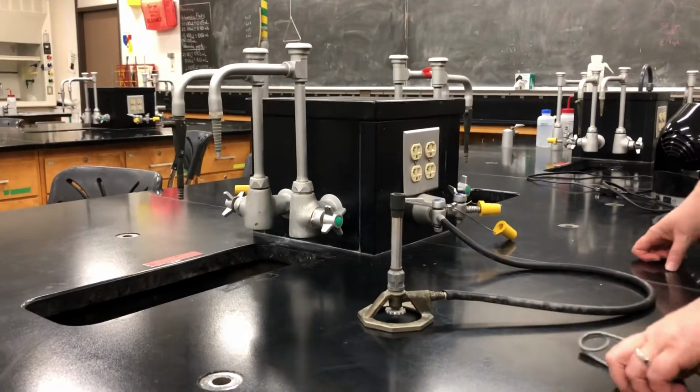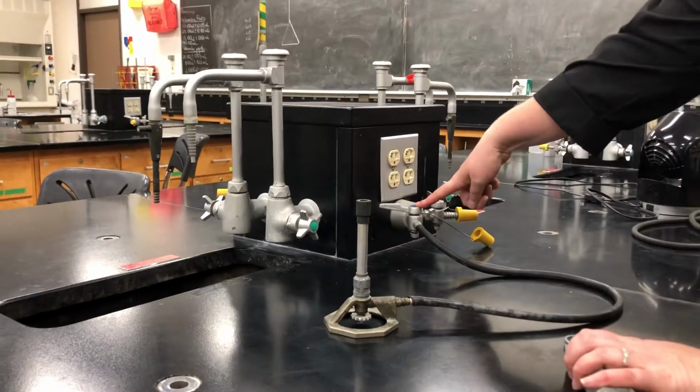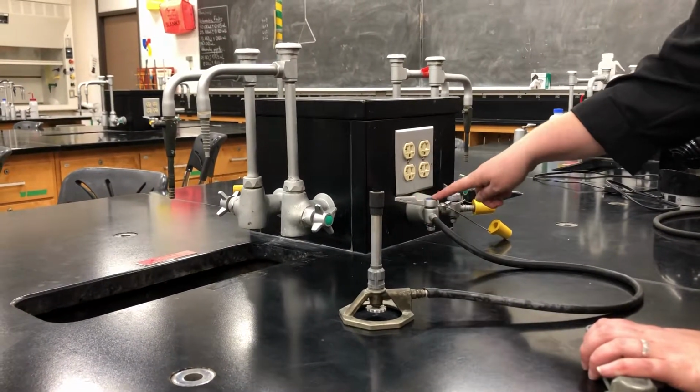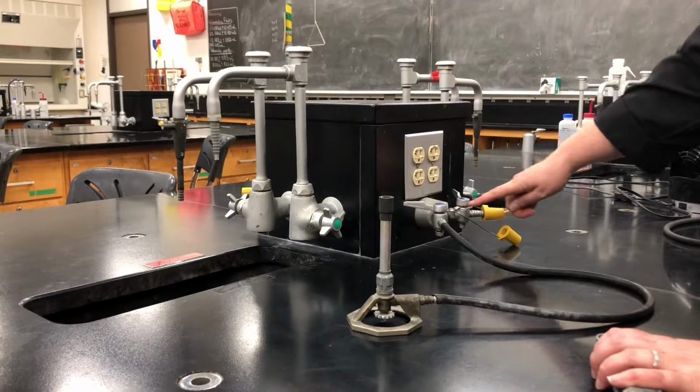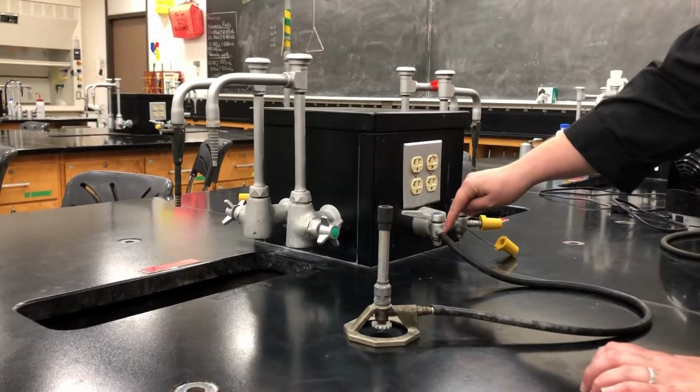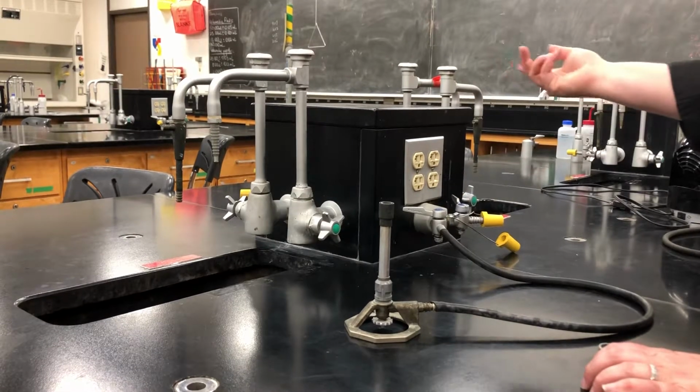Next, we're going to turn the gas on. So right now it's in the off position. It's 90 degrees away from the nozzle. If it was over on this side at 90 degrees, it would also be in the off position. And then when the handle is pointing with the nozzle, that's when it's turned on.